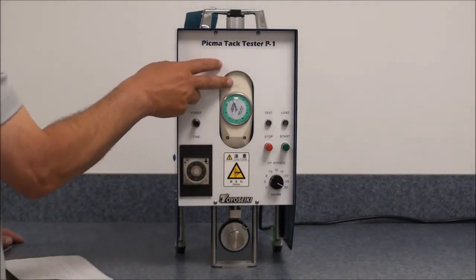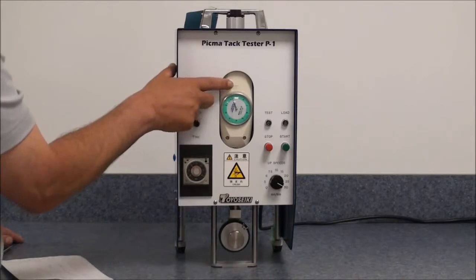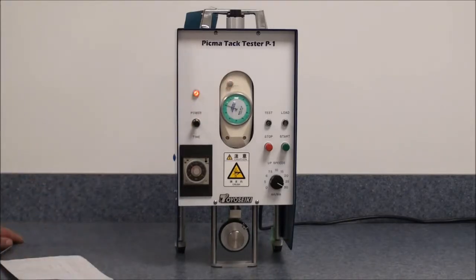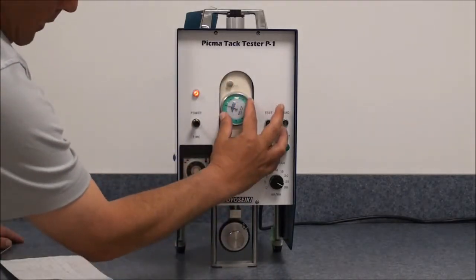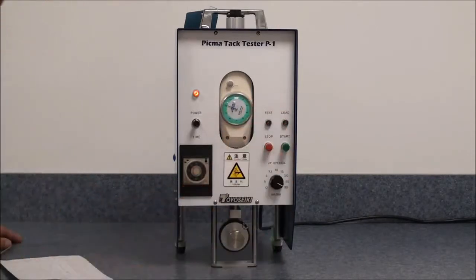Make sure the dial indicator is set to zero by pushing the little button. You can make adjustments if needed to line up to zero perfectly.